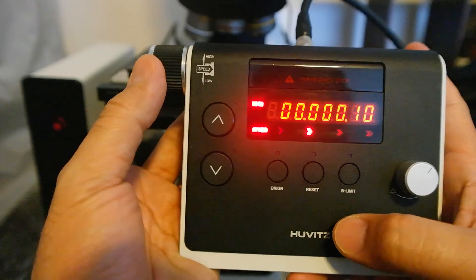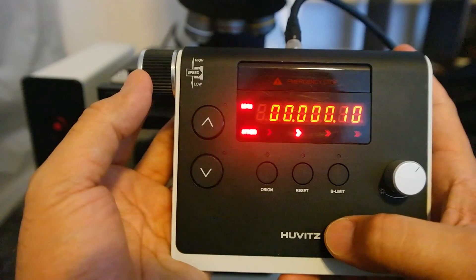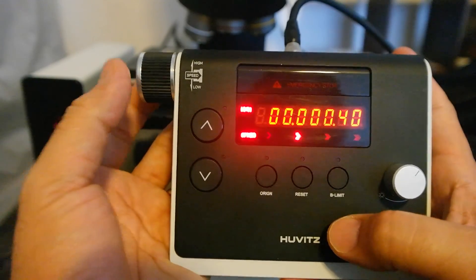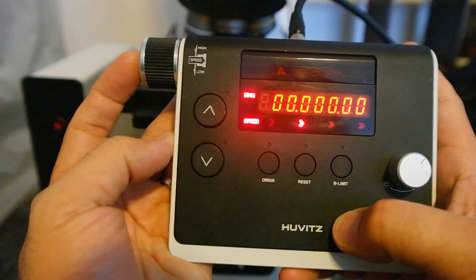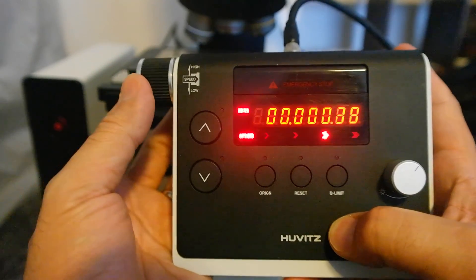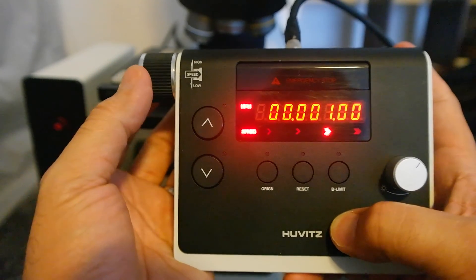If I reset this and I move this it's 0.1, 0.2, 0.3. And again if you reset this and move to third level, then this time it's 50 times faster.